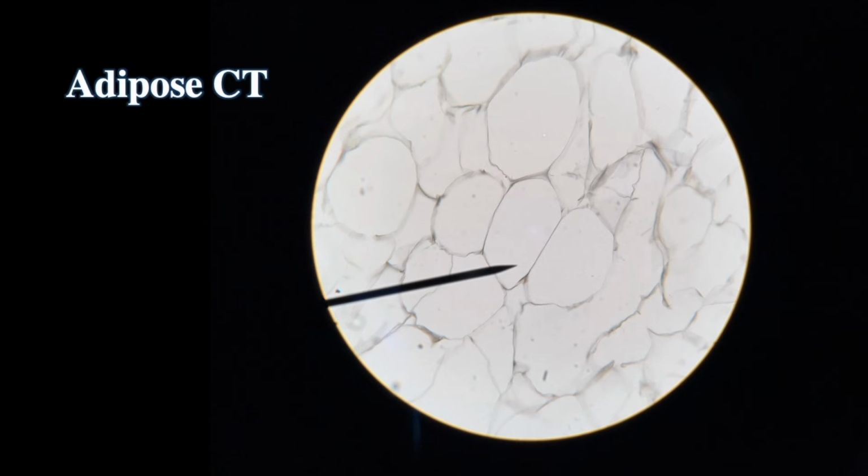Very clear. Now, do you remember all the way back to our first slide? That was simple squamous epithelium. This does, in a way, look like simple squamous. You got those multiple sides. However, the nuclei are gone. Where are they? Well, they're tucked in the corners. This is fat tissue. Adipose is fat. How I remember it is, the fat cells are so fat that they push the nuclei into the corners.